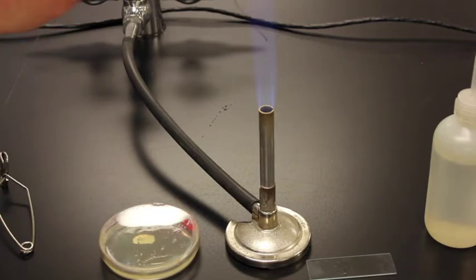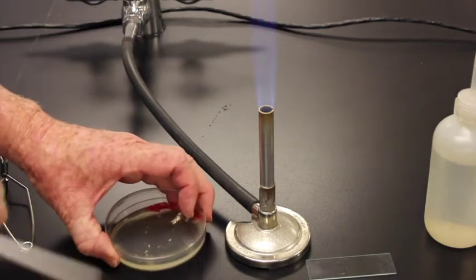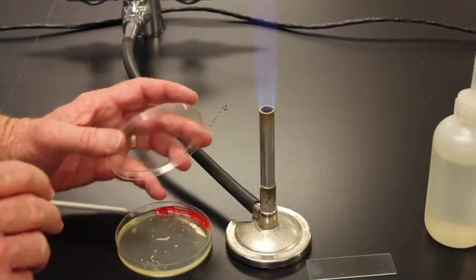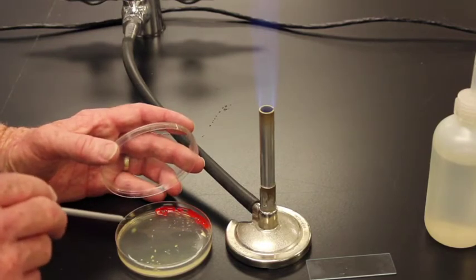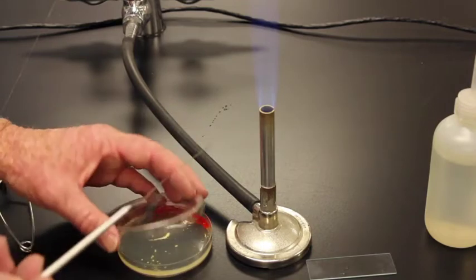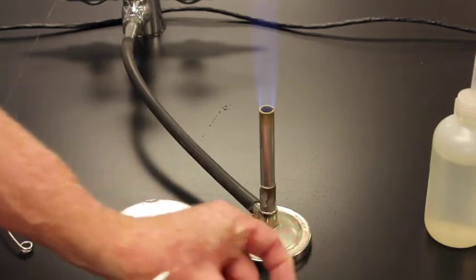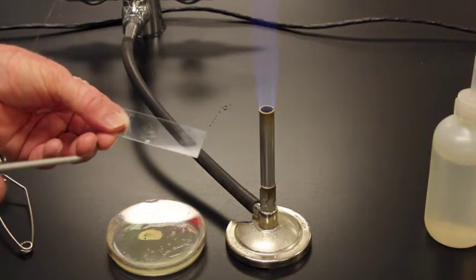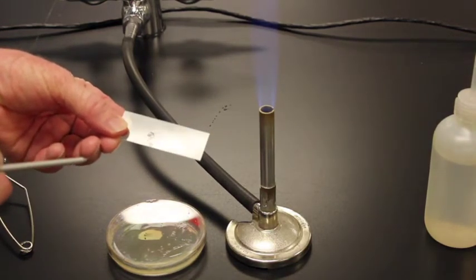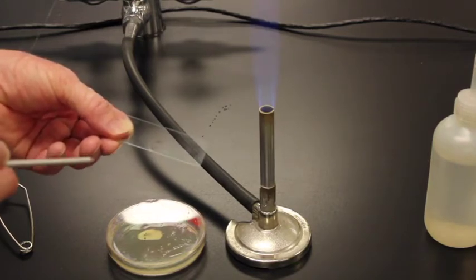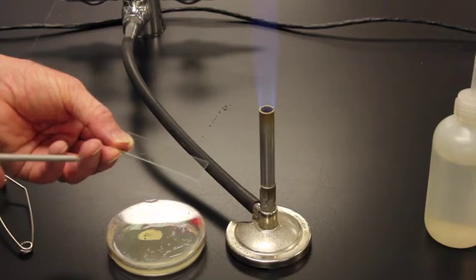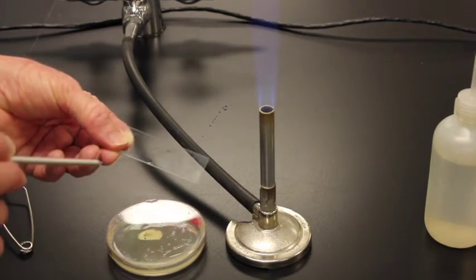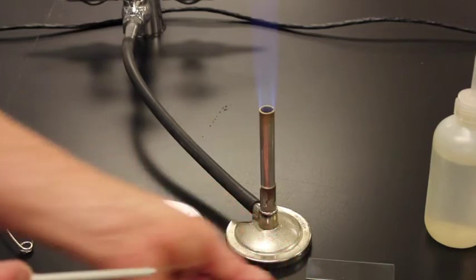Now what I'm going to do is I'm going to flame my loop. We want to get bacteria in that drop of water. So as you saw before, it's really hot. So I go here, flame my loop. I'm going to lift up my plate gently because I don't want all the bacteria on my plate. And I'm just going to cool off my loop there. And I'm going to get one teeny tiny colony right there. And that has a lot of bacteria in it. Then I'm going to take my plate, my slide, and I'm just going to stir all of those bacteria around in a nice big loop. Now my slide has to evaporate and dry. So I'll keep those all right there spread out because we want that slide to dry. I'm going to set it here and wait for it to dry.